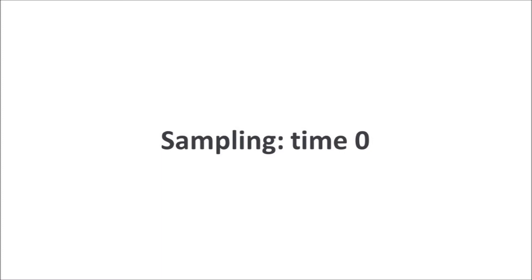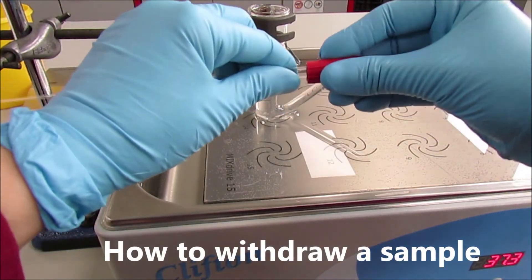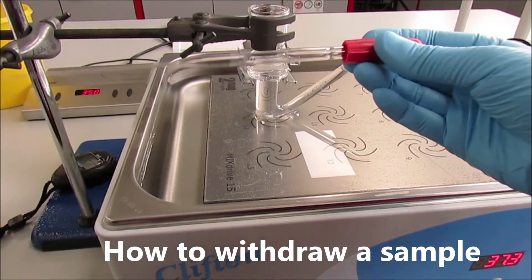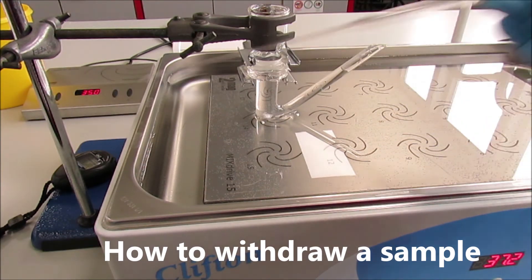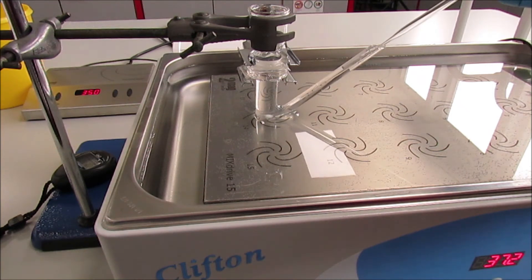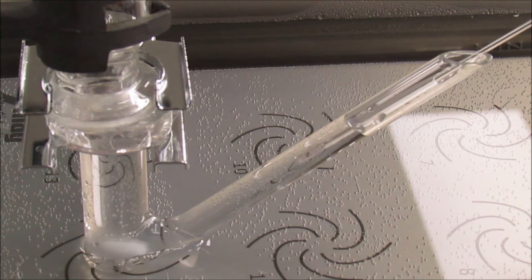That's how we will be assembling the Pasteur pipettes that we will use for sampling. That's how it is inserted inside. We need to make sure that we will not insert air bubbles into the receptor compartment.